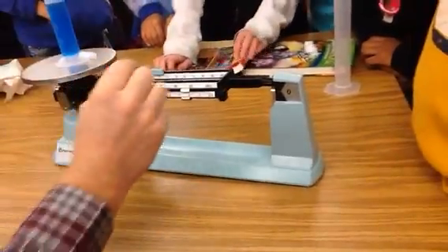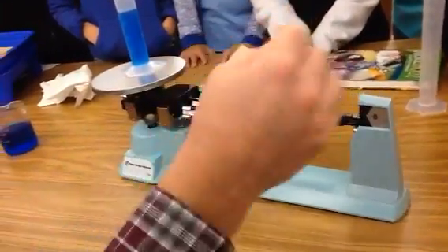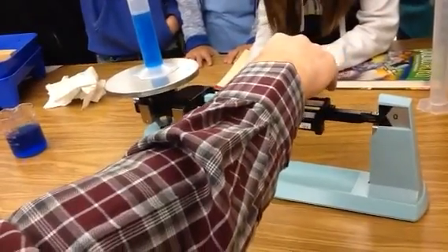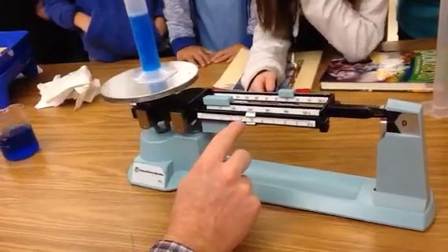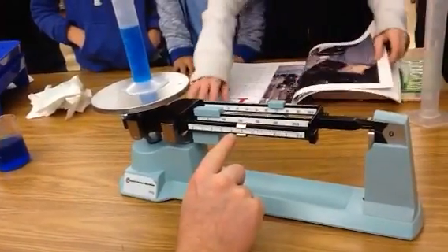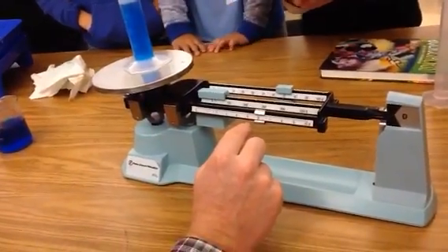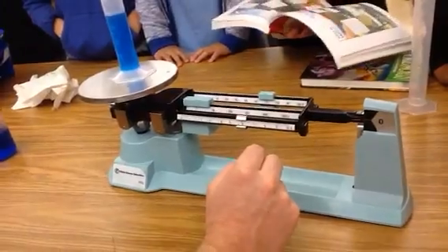And now we're going to put this on the scale. We're going to go to the zeros and we'll go to 100 first — it goes down so we know it's under 100. I'm going to keep going along here until it goes down. So we're at 70 now, and we're going to move 70. Don't ever touch the actual beam, just touch the little metal marker. So you're going to keep moving this until it's even — the zero marker with the pointer. I went a little too far, so it's about 76. Our total is 76.